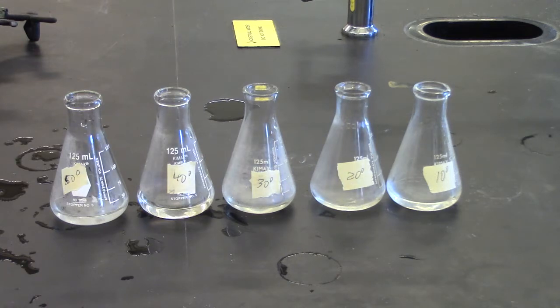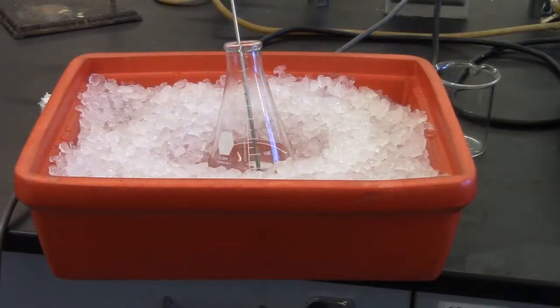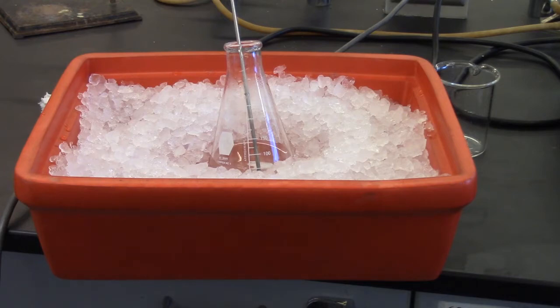For the 30 degrees Celsius, do not use an ice bath. You should try to allow at least 10 minutes for each 10 degrees decrease in temperature. For your 20 degree and 10 degree samples, you will need to place your borax solution in an ice bath.